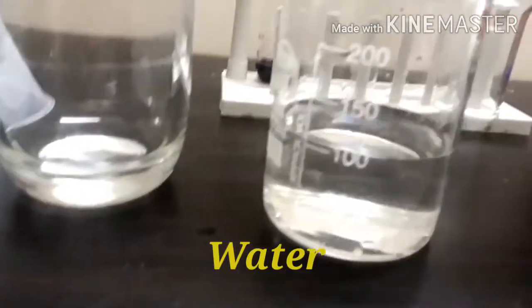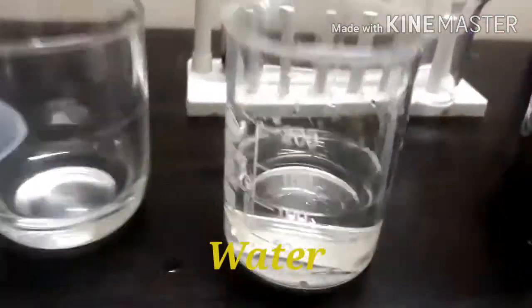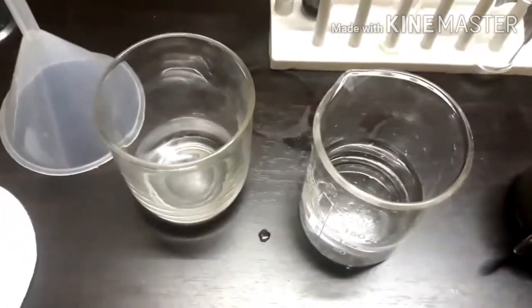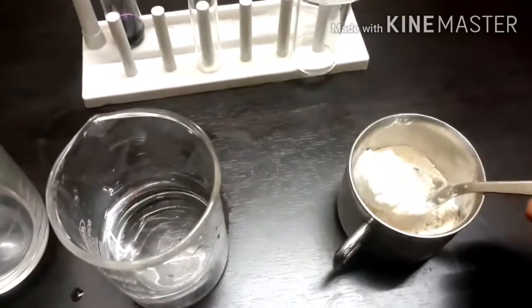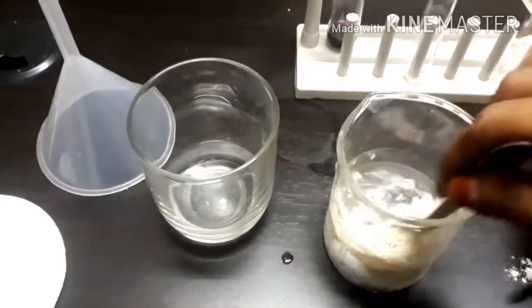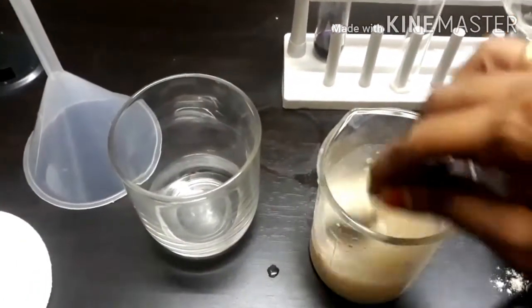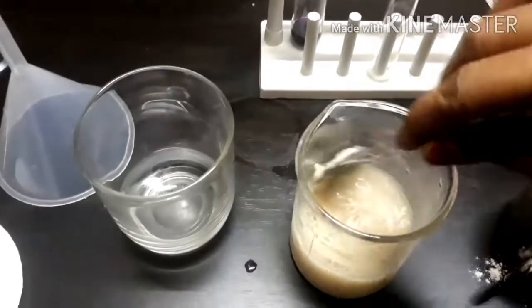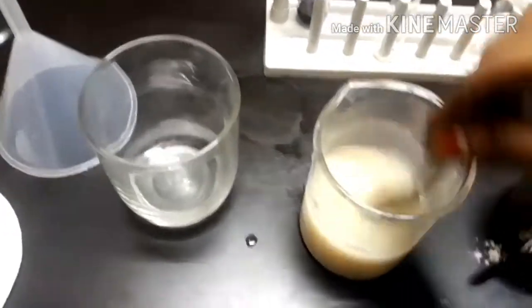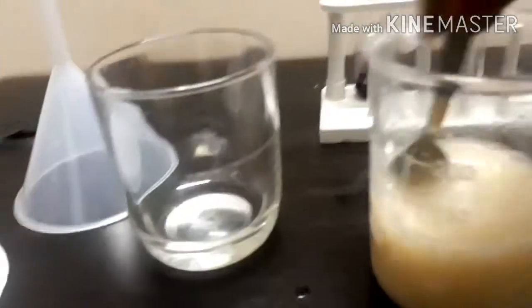I took 100 ml of water in a beaker. I prepared a wheat solution by adding one teaspoon of wheat flour powder in 100 ml of water. Stir it well and observe whether the powder has uniformly spread in the water or not.